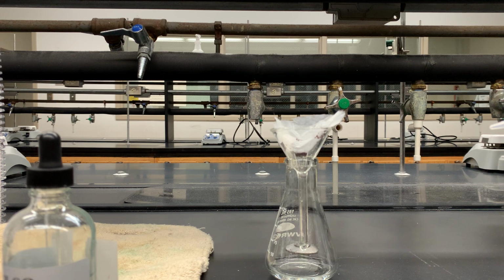copper can form. We saw a soluble ionic compound, and then we later saw an insoluble or pair of insoluble ionic compounds. I hope this was helpful in visualizing copper in its different forms and different types of reactions, especially those that are oxidation and reduction reactions.